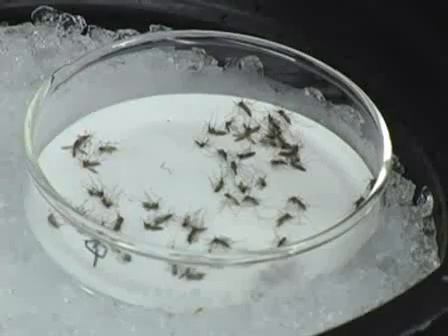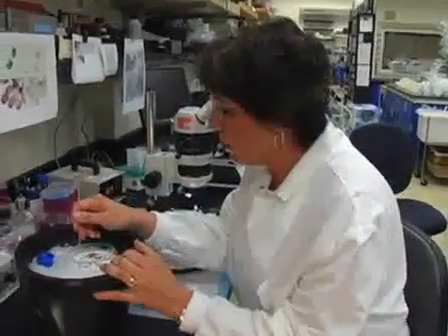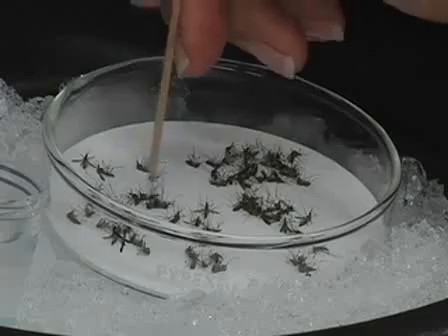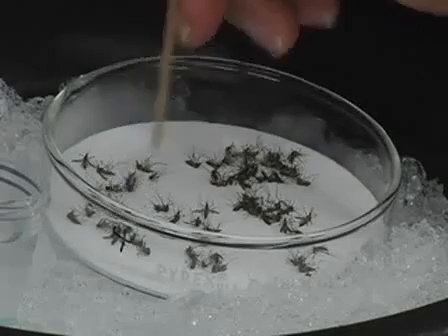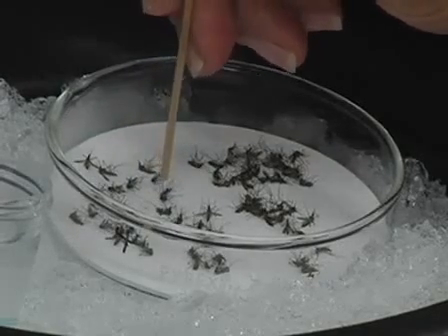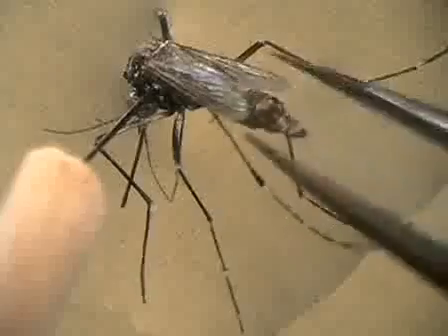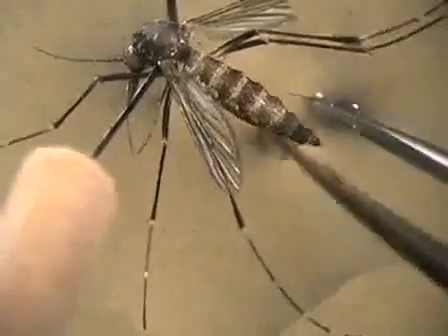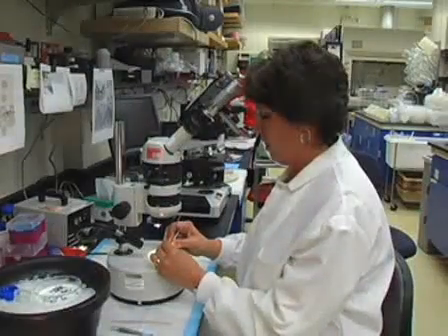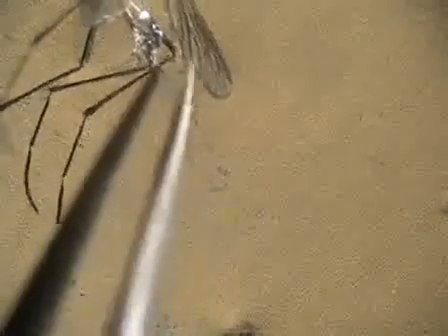I have a cold block to keep the mosquito from flying away while we're dissecting. To get a midgut, I have to pin the mosquito down. I use a probe that I've made and put it through the thorax of the mosquito. Once I put it under the microscope, I pick up the forceps, take the very end of the abdomen section, and pull it off.